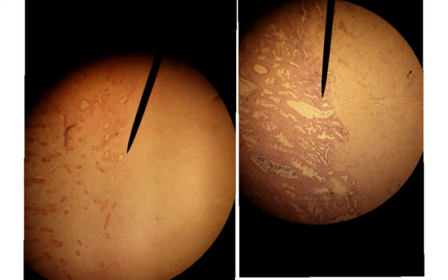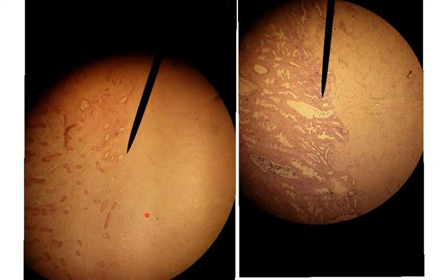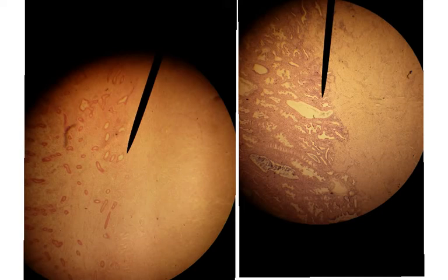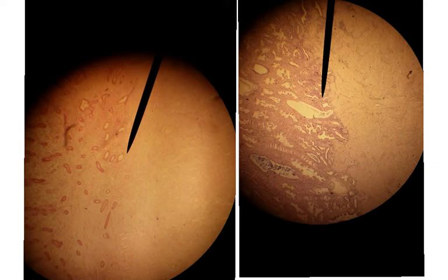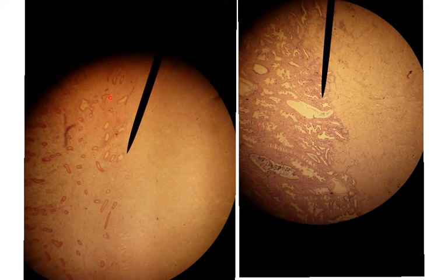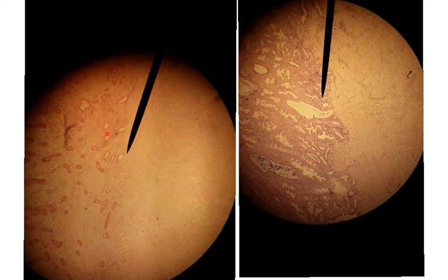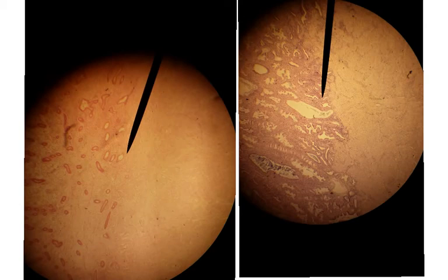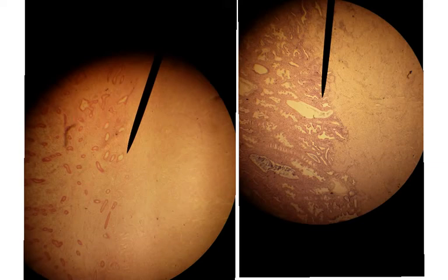Looking at the proliferative phase on the left, there are two regions that are pretty noticeably different, and the pointer is showing that dividing line. On the right side there's not a lot going on — this is called the myometrium. Remember the prefix myo means muscle; the myometrium is the smooth muscle of the uterus, responsible for labor contractions. On the left side we've got the endometrium, which is evident by these open spaces called uterine glands. In the proliferative phase, the uterine glands are relatively small with very smooth edges.